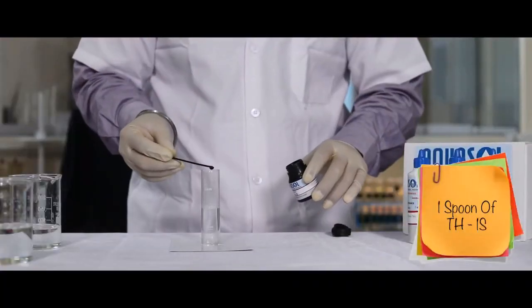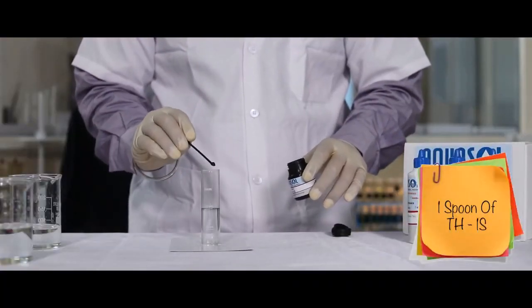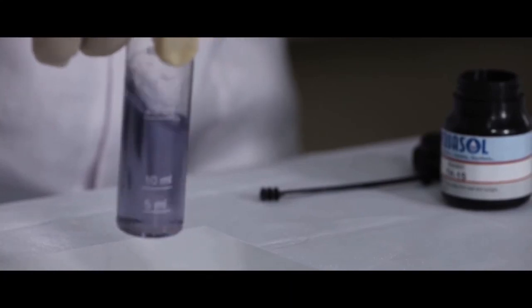Add one spoonful of TH1S. Mix well to dissolve.